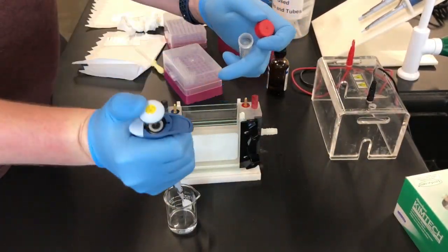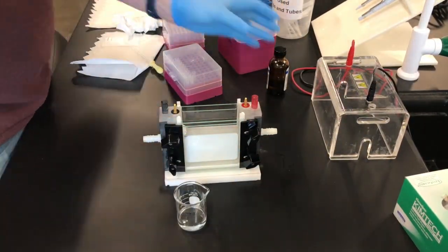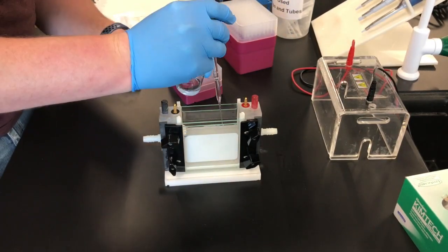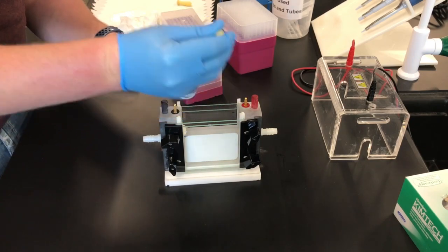Once this is done, you can get your stacking gel buffer, add the APS, and then when you are ready, add the TEMED. Quickly pipette it into the gel and fill it all the way up to the top.